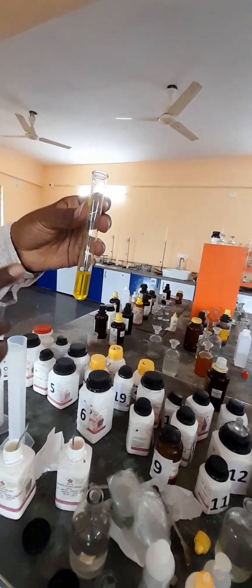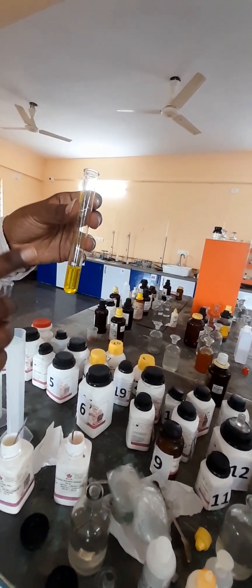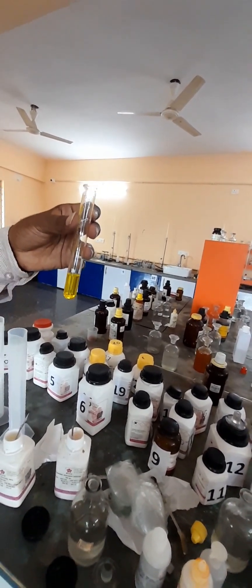This indicates very clearly: K2CrO4 has been changed into K2Cr2O7 in acidic medium. Again, K2Cr2O7 has been changed into K2CrO4 in alkaline medium.